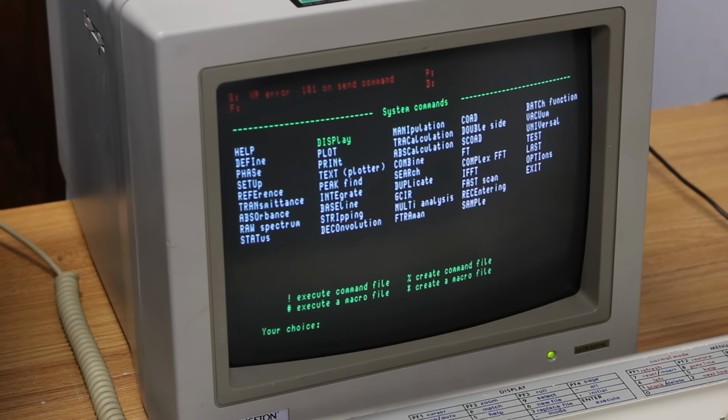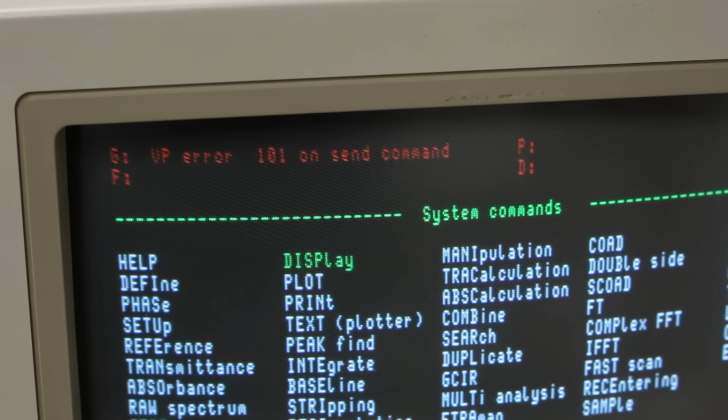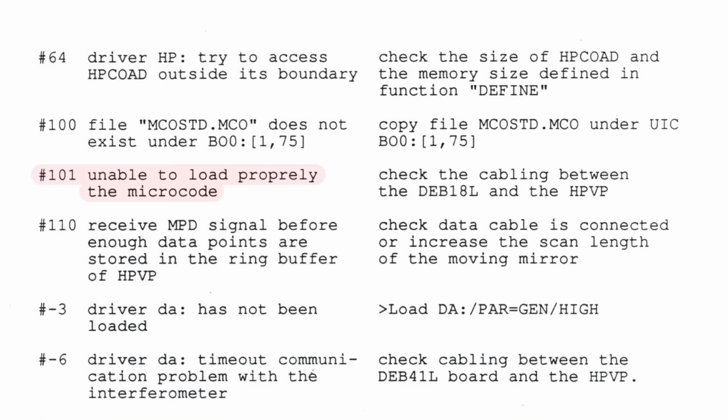It says it's loading microcode, VP error 101 on send command. That's not good. All right, if I check the manual, it says that error 101 is a failure to load microcode, which indicates a communication problem between the DEB-18 and the vector processor. So it's something before we even get to the spectrometer.